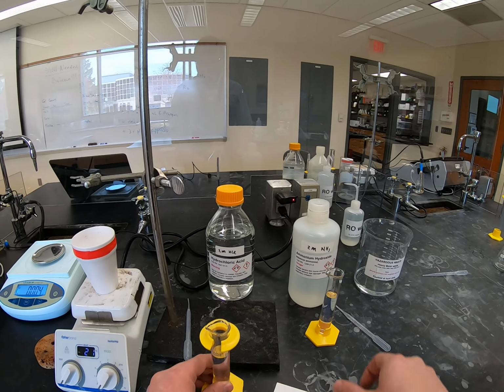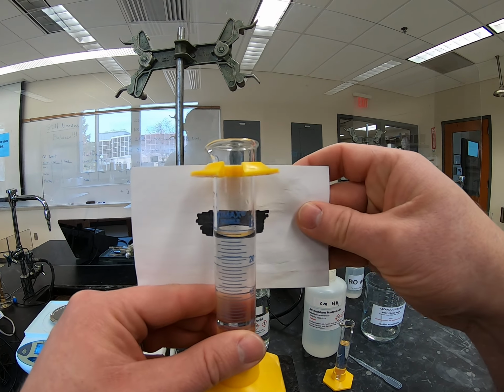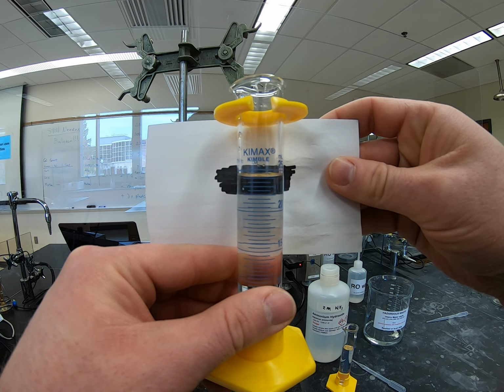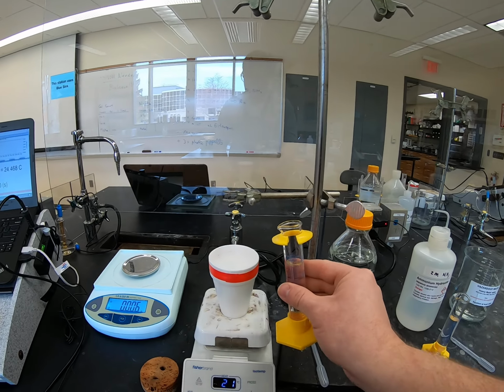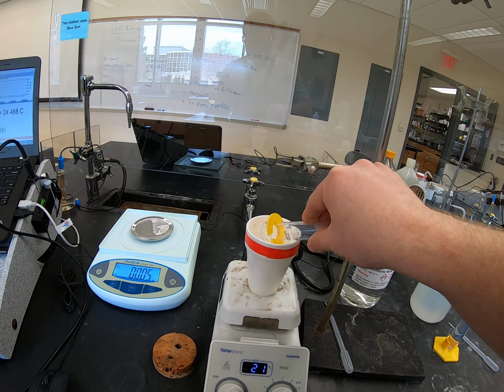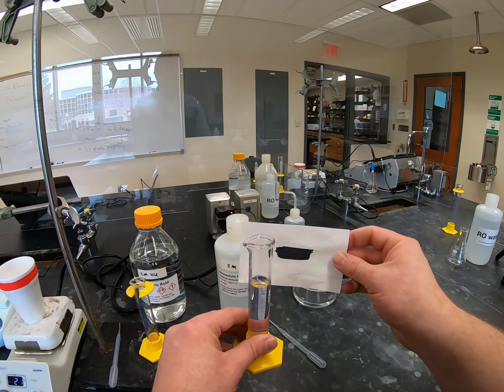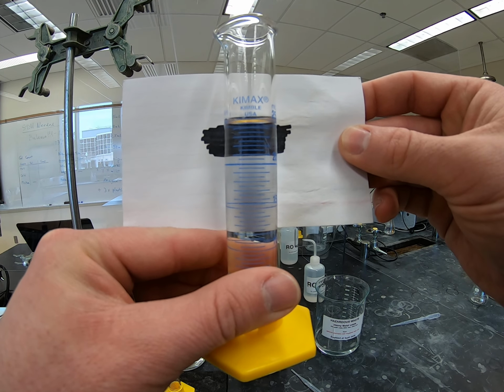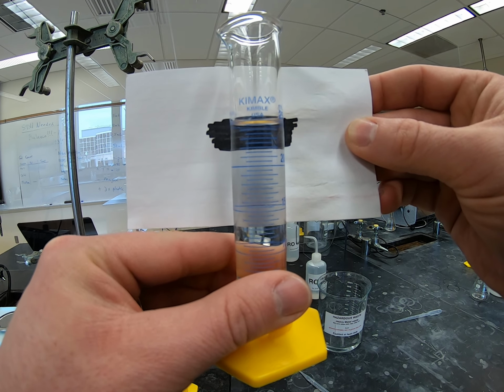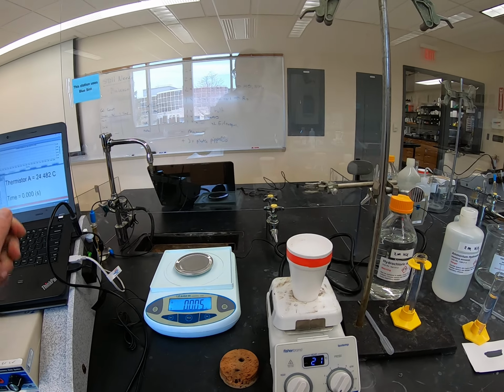Okay, so this is hydrochloric acid. Okay, so you need to record this volume. So here is our hydrochloric acid. Make sure that you record the exact volume. Okay, and we're going to go ahead and throw our hydrochloric acid in here. Okay, and let's do our ammonium hydroxide, or ammonia. So get an exact volume for the ammonia here. Okay, and we're going to hold that to the side for just a moment while we get our initial temperature.